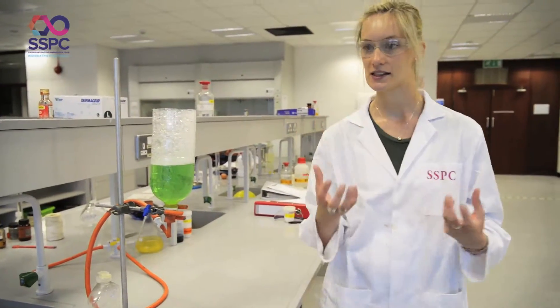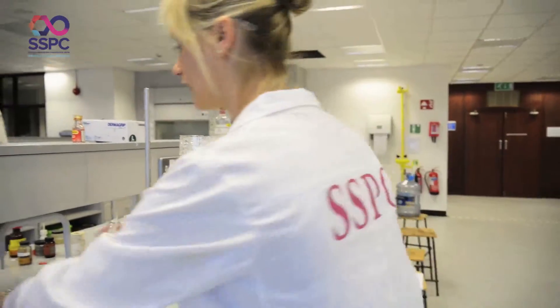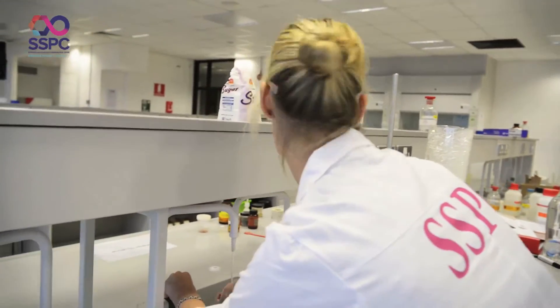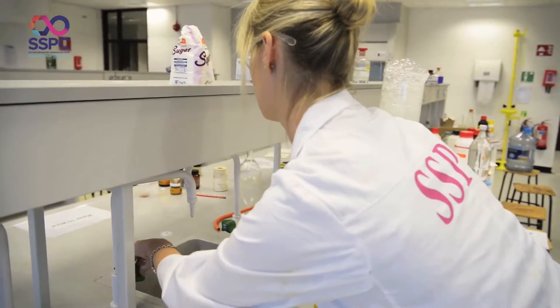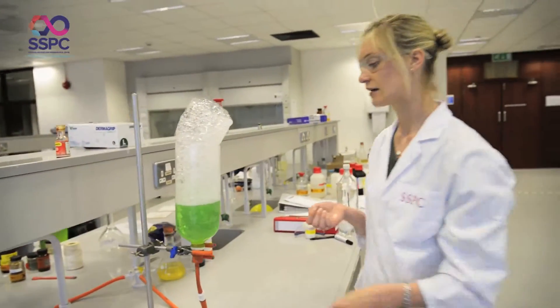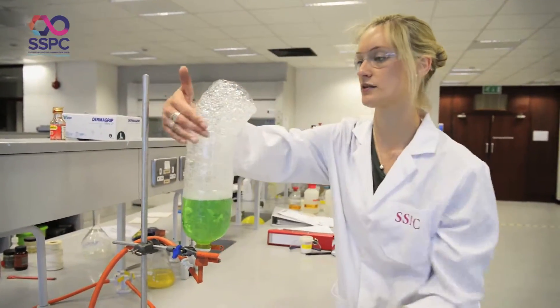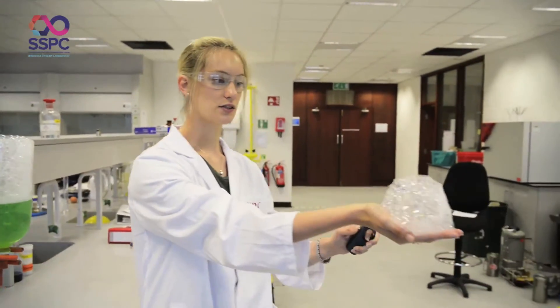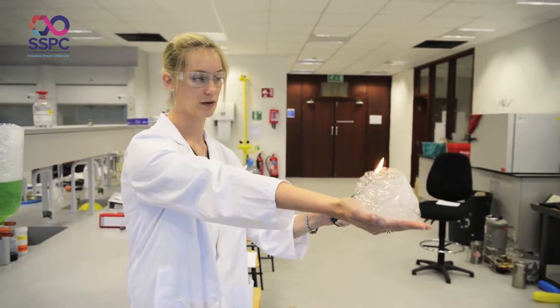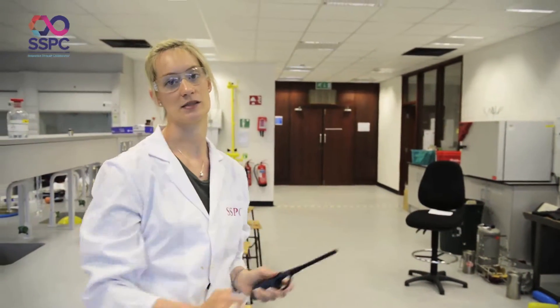What we can do to make this demonstration even more spectacular is we can light our hands on fire. The important thing here is to wash your hands and have plenty of water, which will help to insulate. As I mentioned, methane is less dense — it's lighter than air — so we don't have too much of a problem; it will rise upwards. My arm is outstretched well away from me. I light the bubbles, nothing else. And I get a very spectacular demonstration.